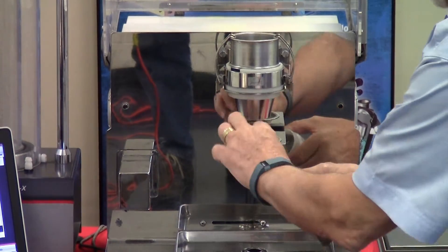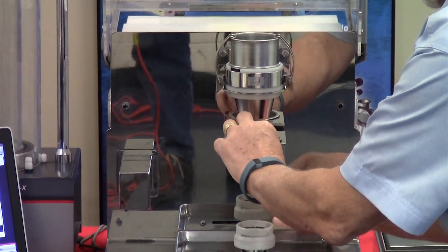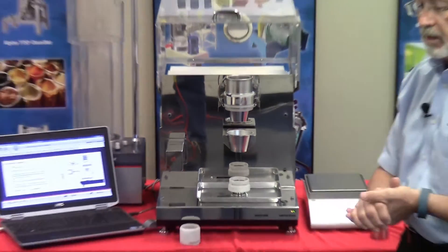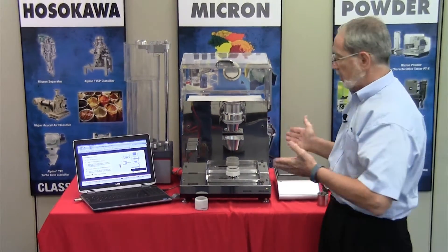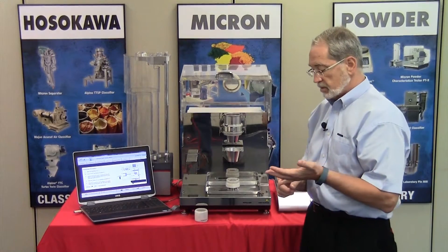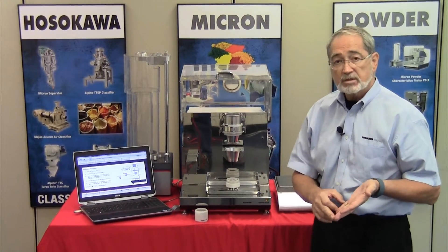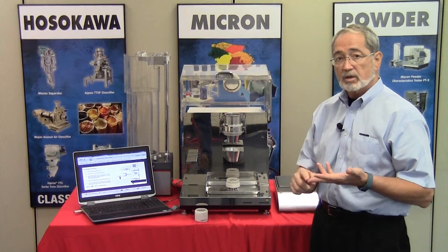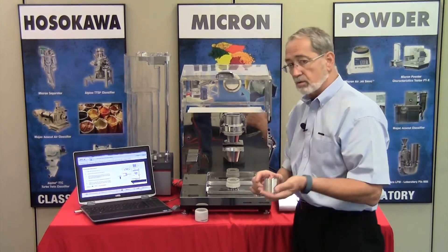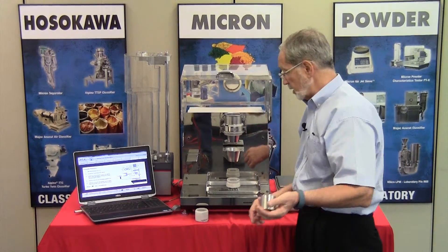Next is the cup holder. There are three different size cup holders offered with the unit: a 25 cc, a 50 cc, as well as a 100 cc. We're going to utilize the 100 cc cup today.